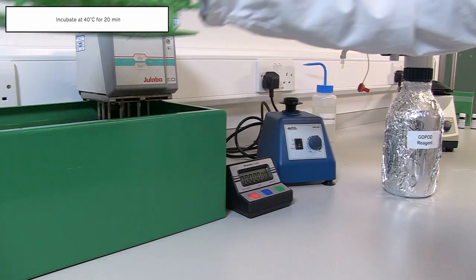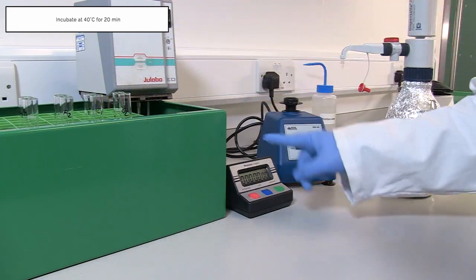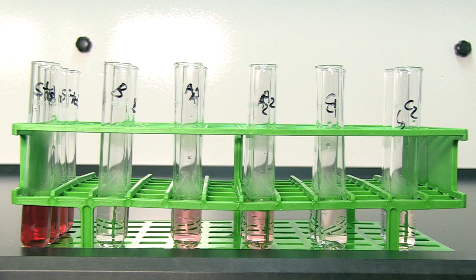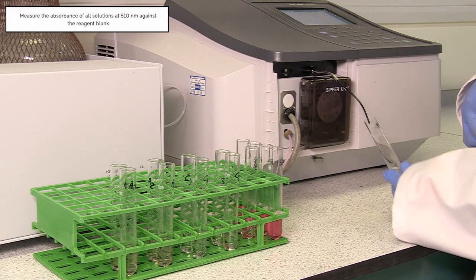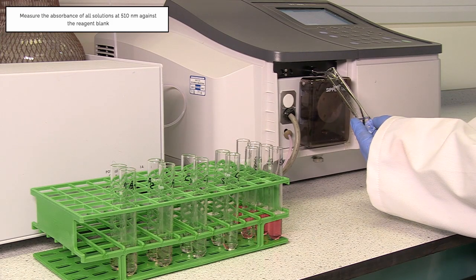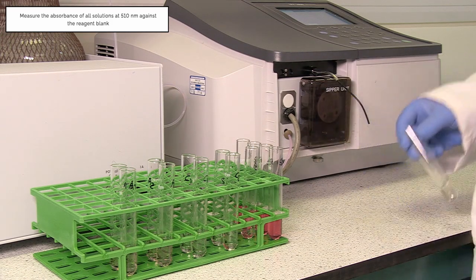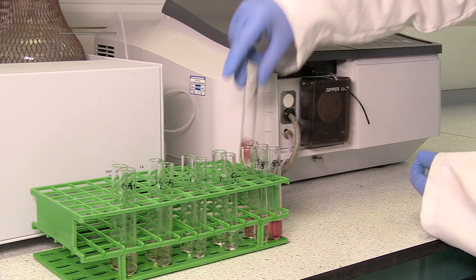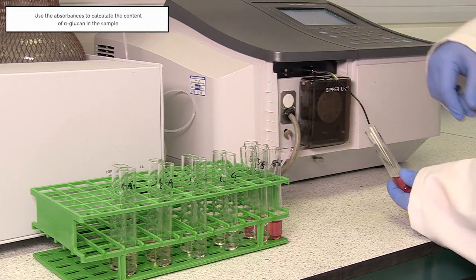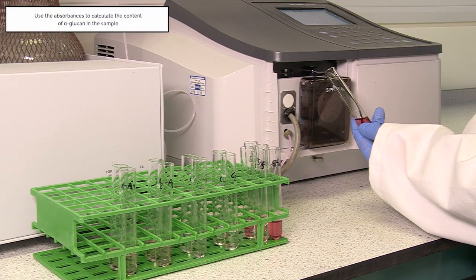Incubate at 40 degrees Celsius for 20 minutes. Measure the absorbance of all solutions at 510 nanometers against the reagent blank. Use the absorbances to calculate the content of alpha-glucan in the sample.